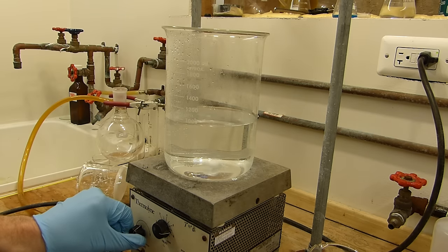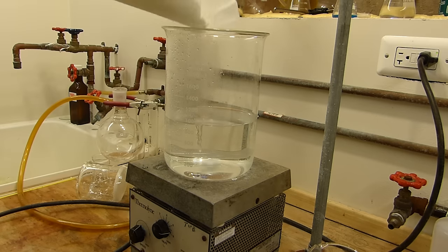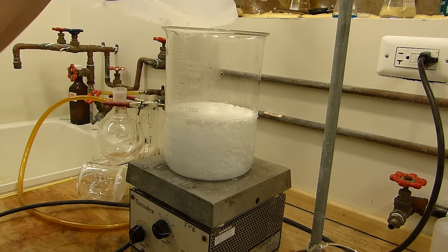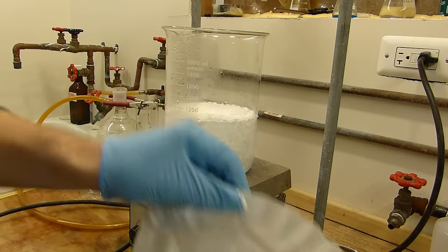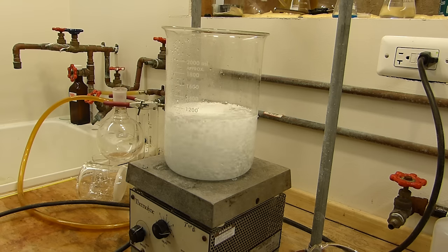So we'll get the stir bar going, and we'll drop in the benzoic acid. And with heating and rapid agitation, we should be able to get all of that to dissolve in over the course of a few minutes.